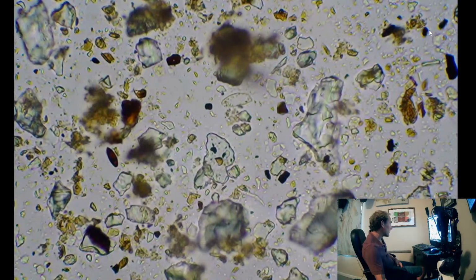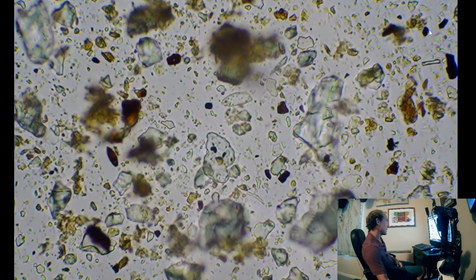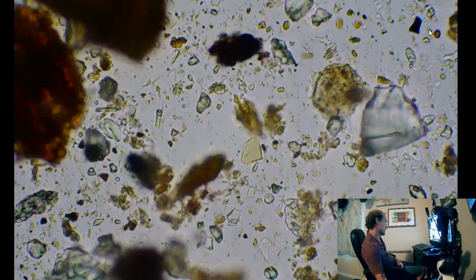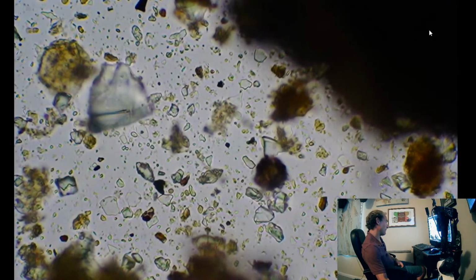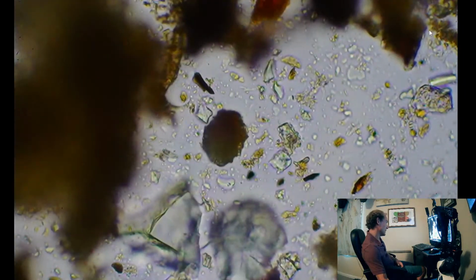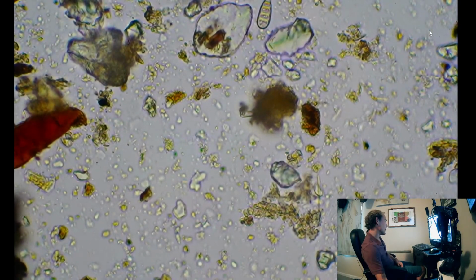So we do have an amoeba in there. That's the first one I've noticed. Usually I see a whole lot more. But that's because we probably only have about 3 inches of good soil and then it hits clay in this bed. So we gotta build it up.